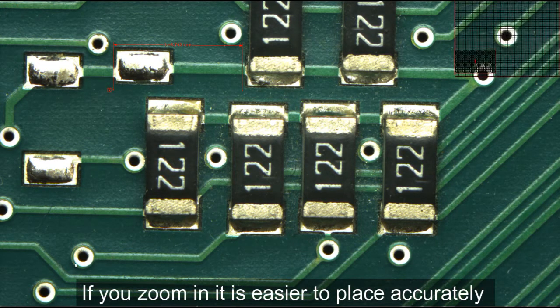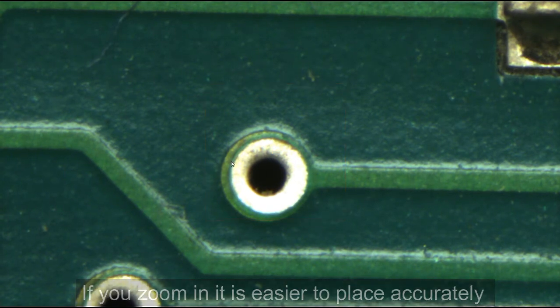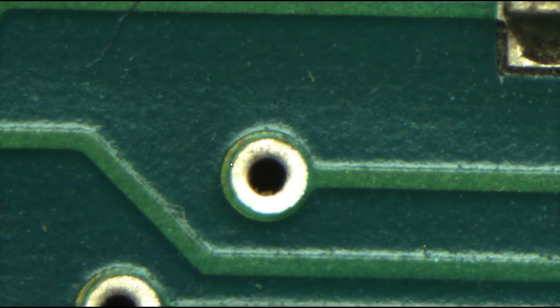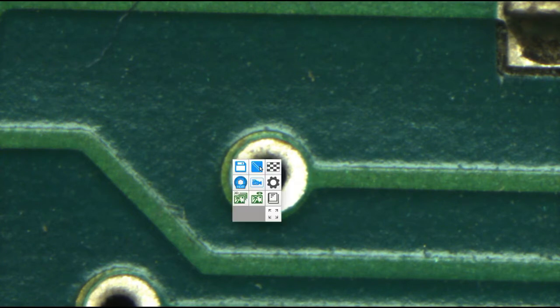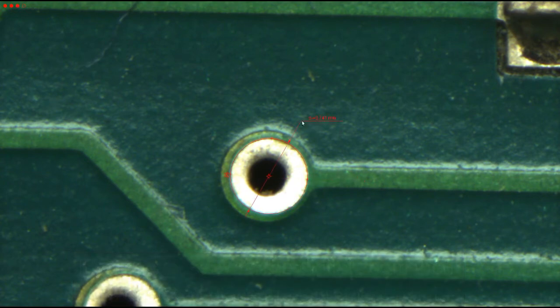If you wish to make precise measurement, zoom in with your mouse wheel and make the measurement at the highest magnification. Let's measure a diameter, for example. Select the graphic element for the circle and then click with your middle mouse button at different points of the arc of the circle.